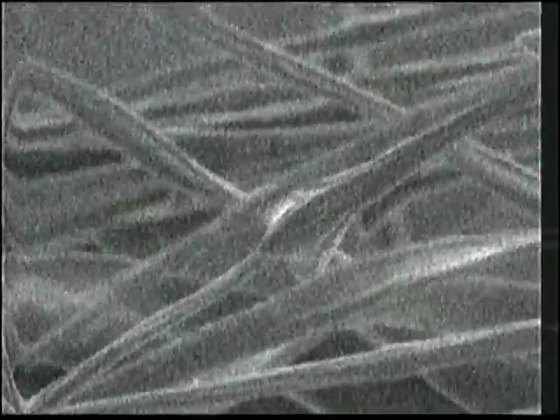Is that the feathers have structures on them that expand from the edges of the feathers, and I think they're there for the clumping to create airspace between the feathers for insulation, and maybe ways of hooking the feathers together or keeping them in line. Maybe these align the feathers for the spaces. Maybe this hollow region right in the middle here, that's the highest magnification, grabs into another piece of feather here and is what causes the feathers to take on their overall orientation.